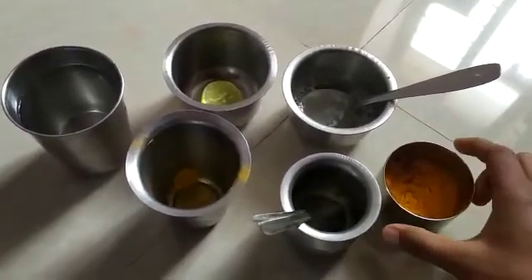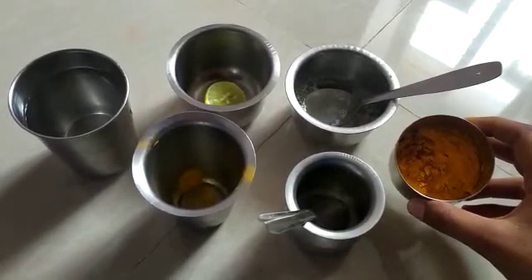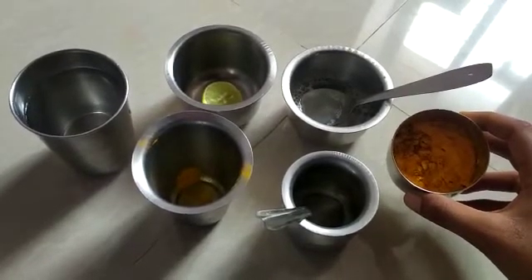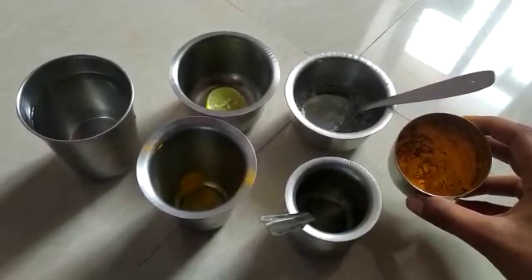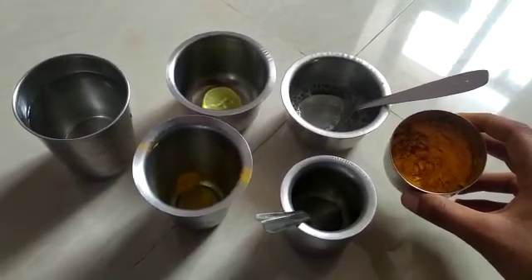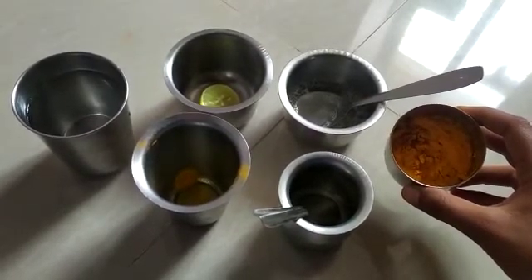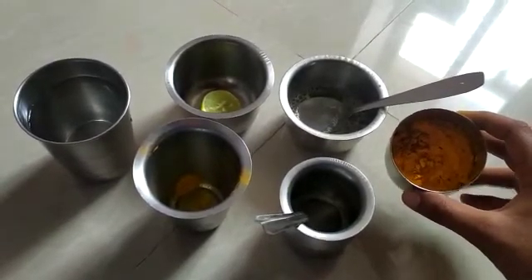Here I have turmeric powder, which you use at home. There are so many uses of turmeric — you use it in cooking. Today we are going to use this turmeric as a natural indicator to see how it changes color for acidic solution and basic solution.